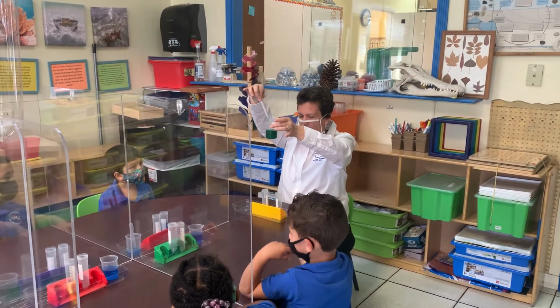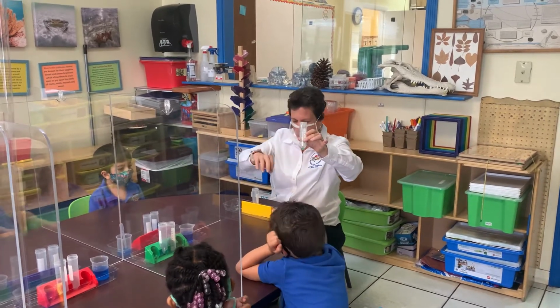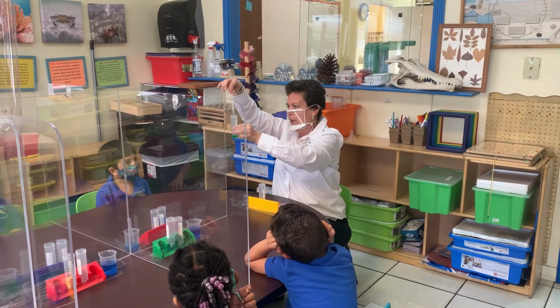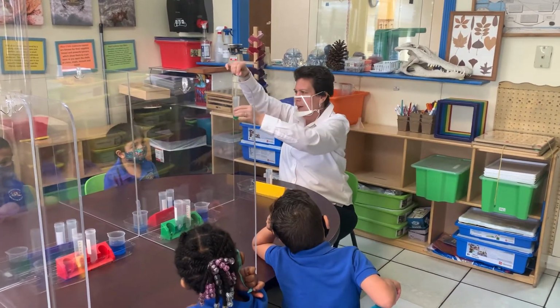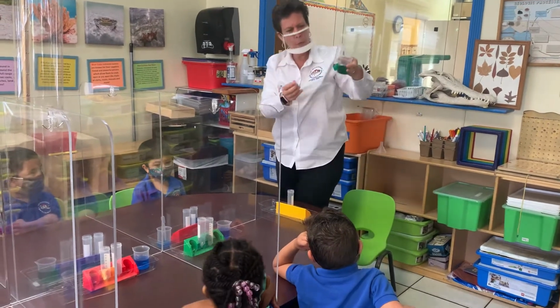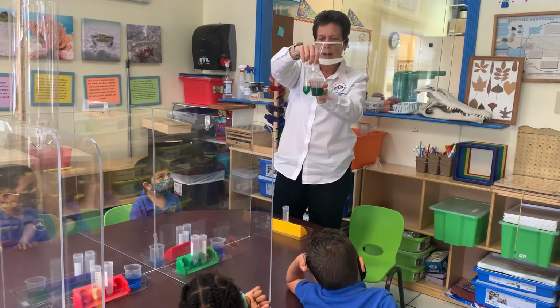All right? Now, what I'm going to do is I am going to fill my, what was this called? Test tube. I'm going to fill my test tube. Okay? Like this. Now there are numbers going up the test tube, and the number I want you to find is 35. Do you know how we make the number 35? A 3 and a 5, good. So I'm gonna keep filling this up, and I want you to tell me when you see it getting right here to the 35, to the 3 and the 5. So when I get there, tell me to stop.